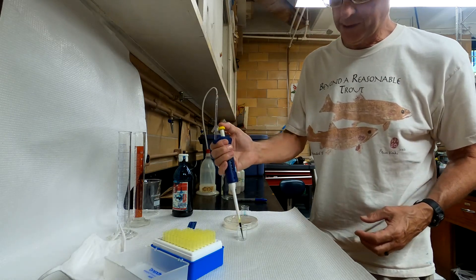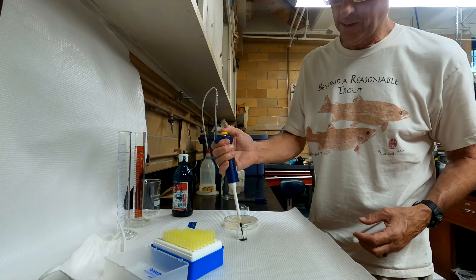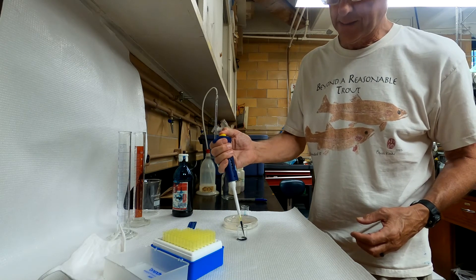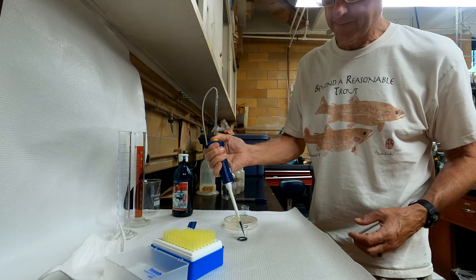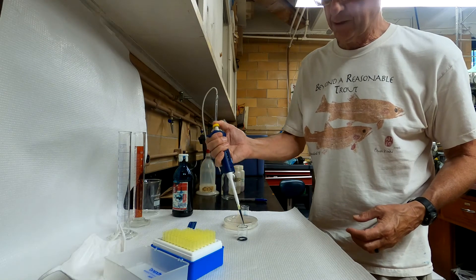Put it in where you're placing your sample, push it down all the way to the second stop, and release it.